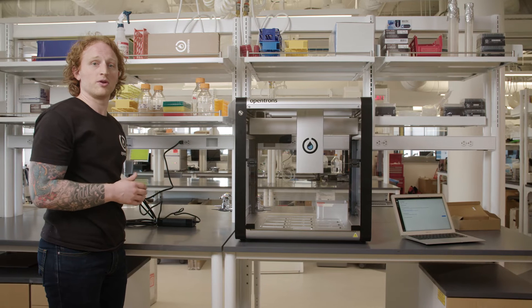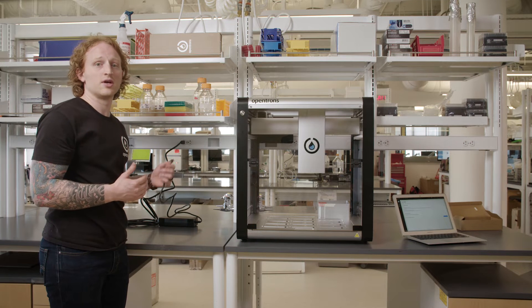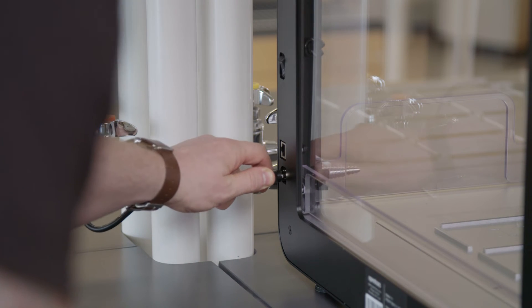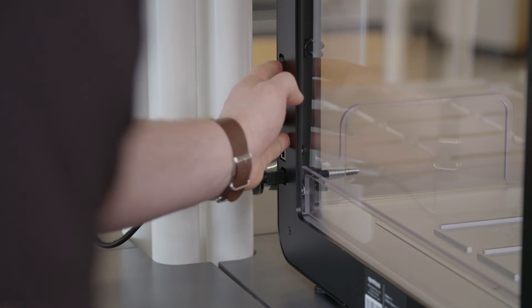The most important thing when you are plugging this into the OT2, and for that matter, any OpenTRONS equipment, is to make sure that the plug is oriented in the right direction. If it is not, you could cause a short circuit on your OT2.